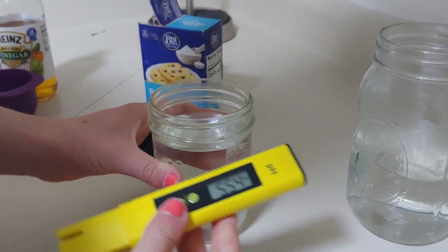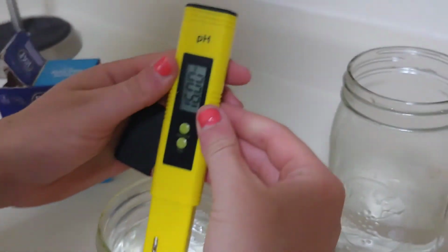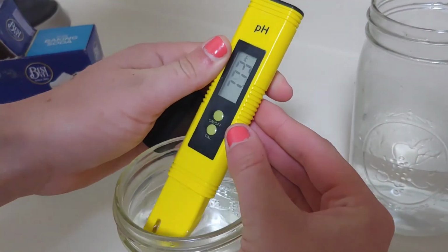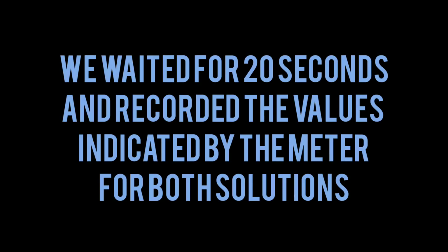So now we're going to measure the initial pH of the solution with the sodium bicarbonate in it. So we're going to stick this in, and we're going to wait probably 20 seconds.